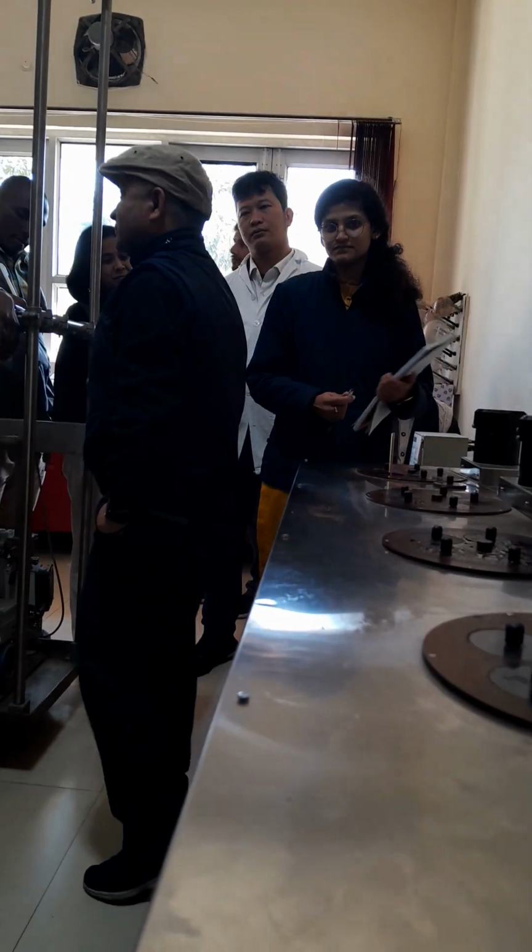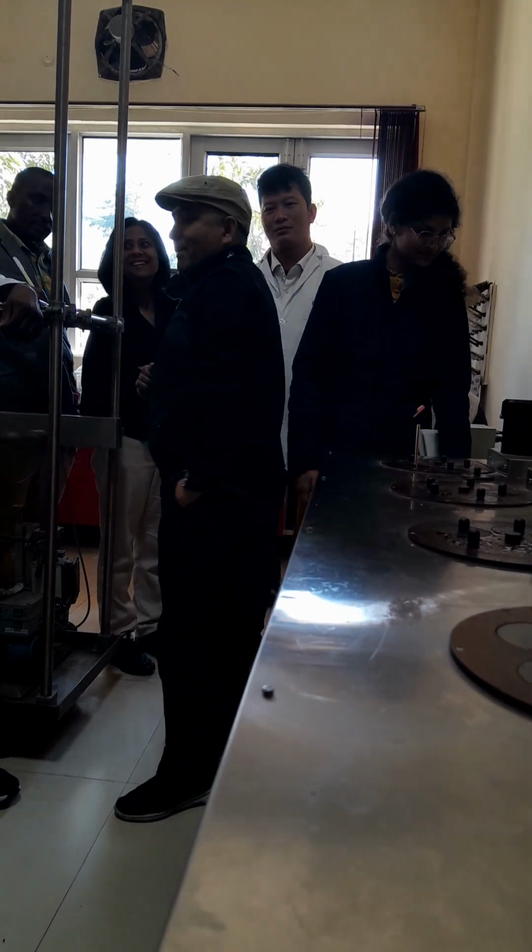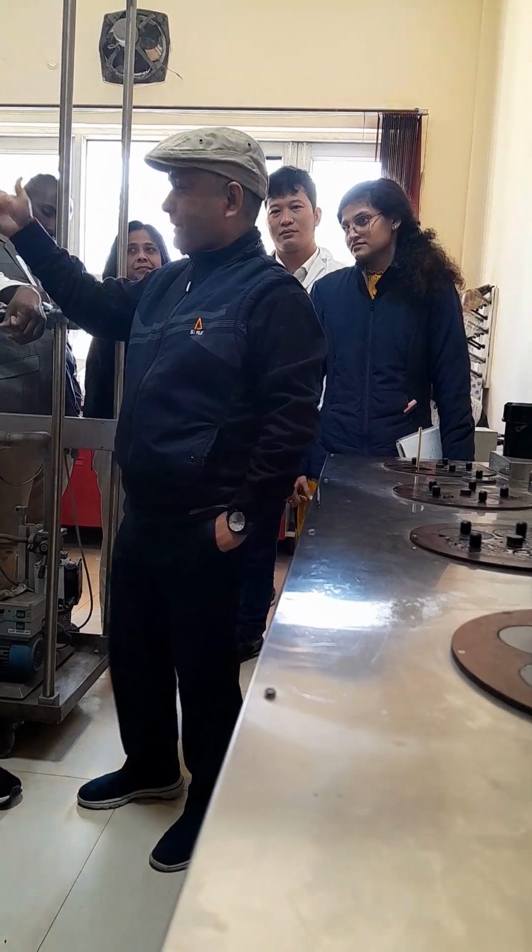This is as per ASTM D97 manual method. Okay. Thank you very much. Before it starts, let me show you another test.